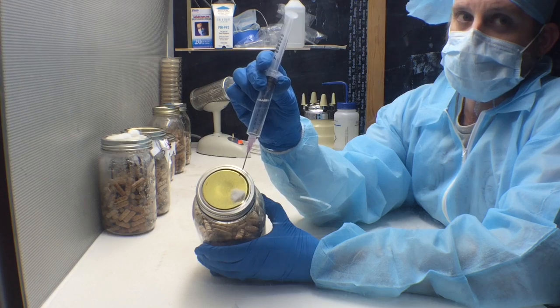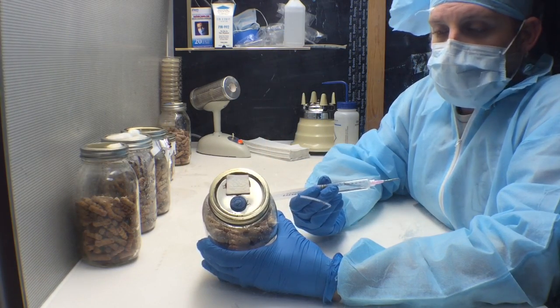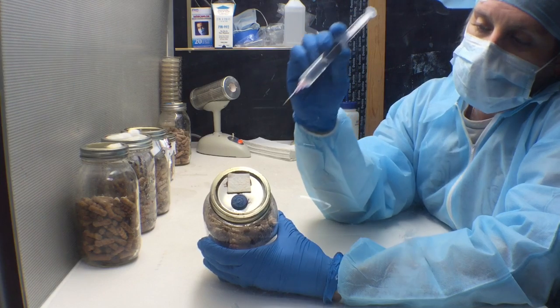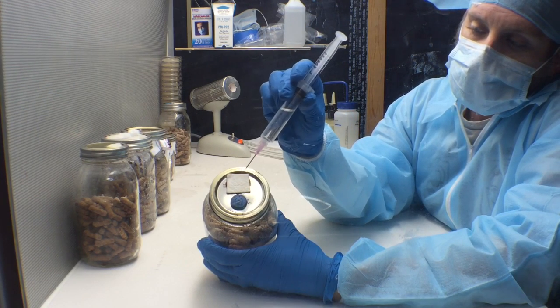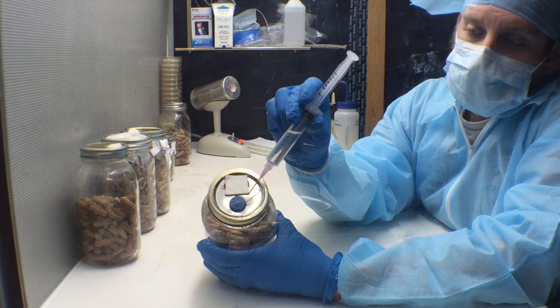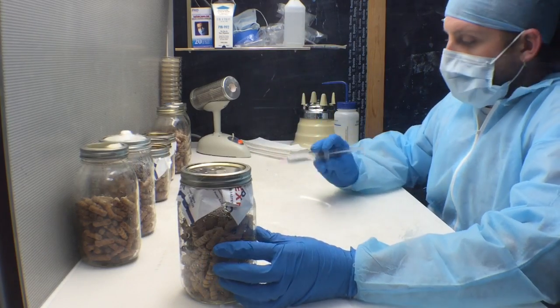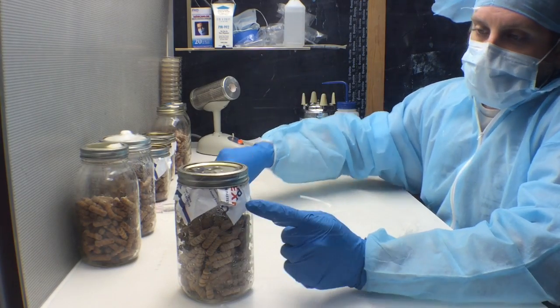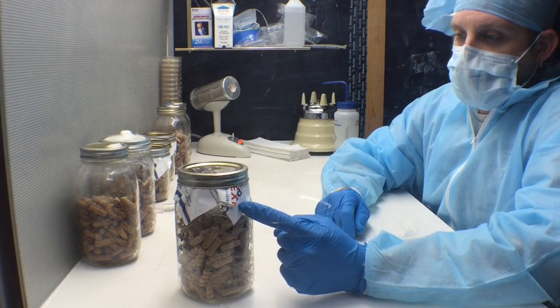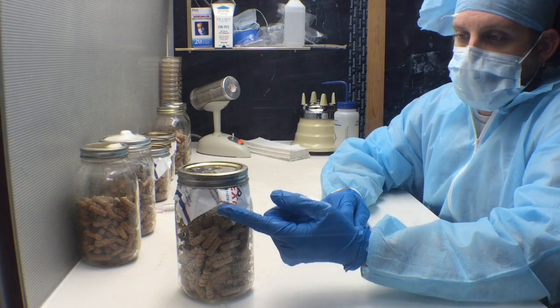This works great and it's very cheap and easy to do. These tops have been fitted with a filter patch adhered to the top with silicone, along with an injection port for easily inoculating your jars in an unsterile area.